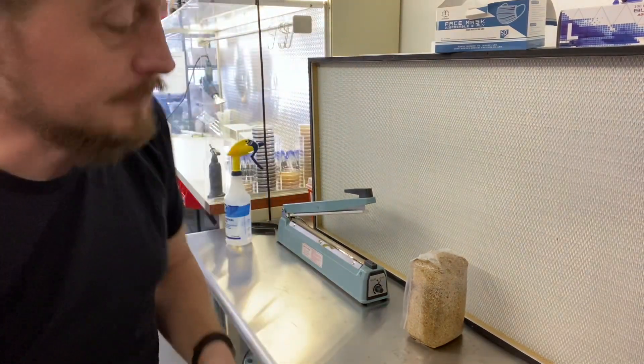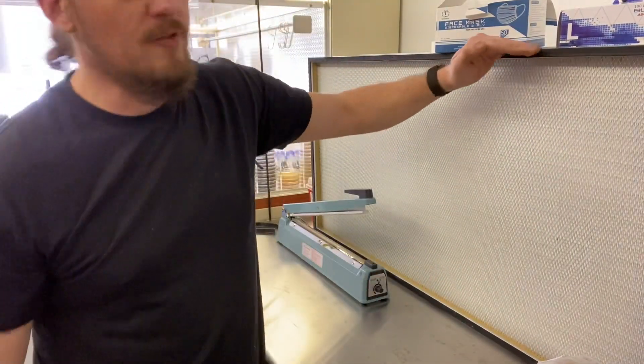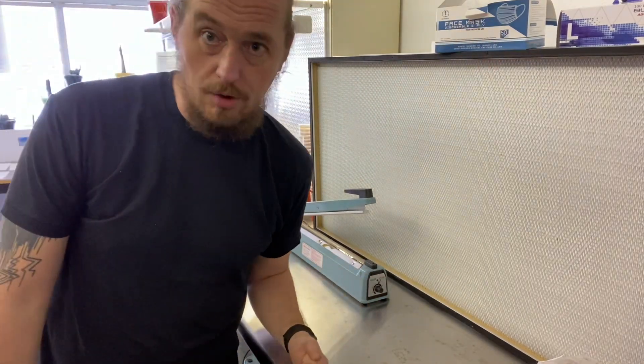Correction — I have already, because I don't want to carry the camera around. But you get the idea. So, aseptic technique. I'm in front of a flow hood. The flow hood — everything from here to about here — is sterile.